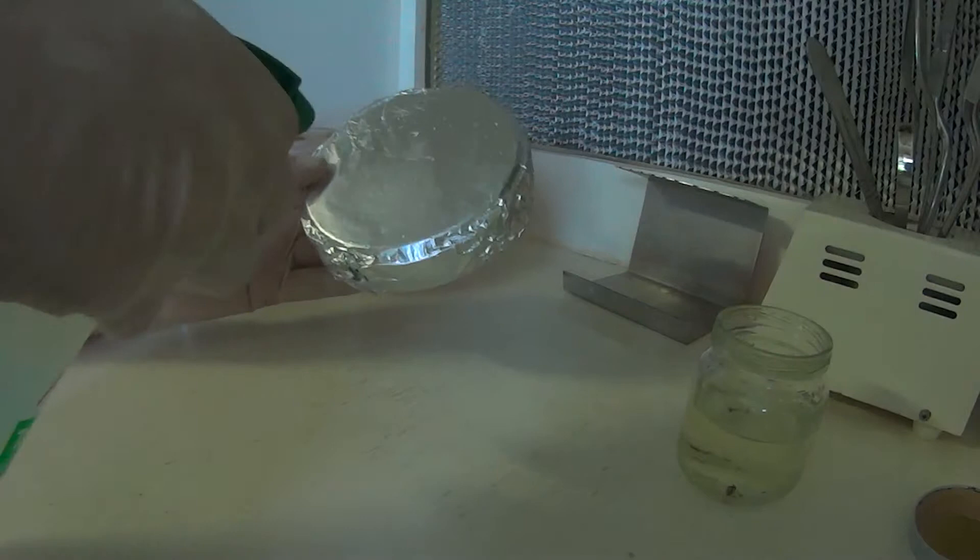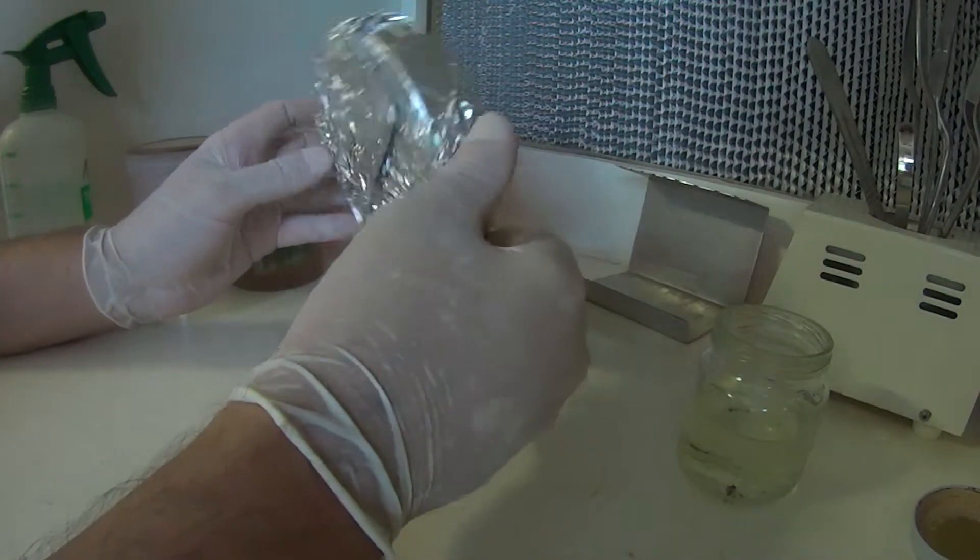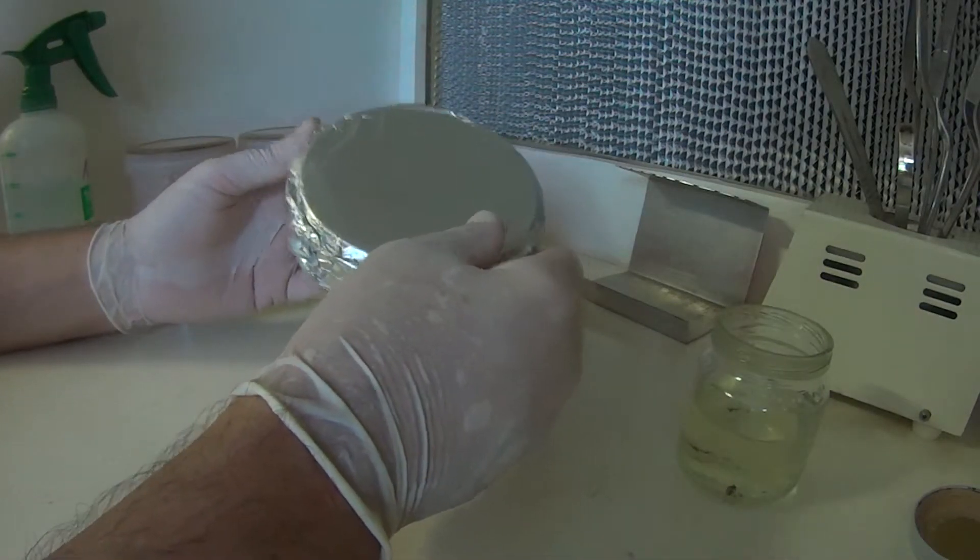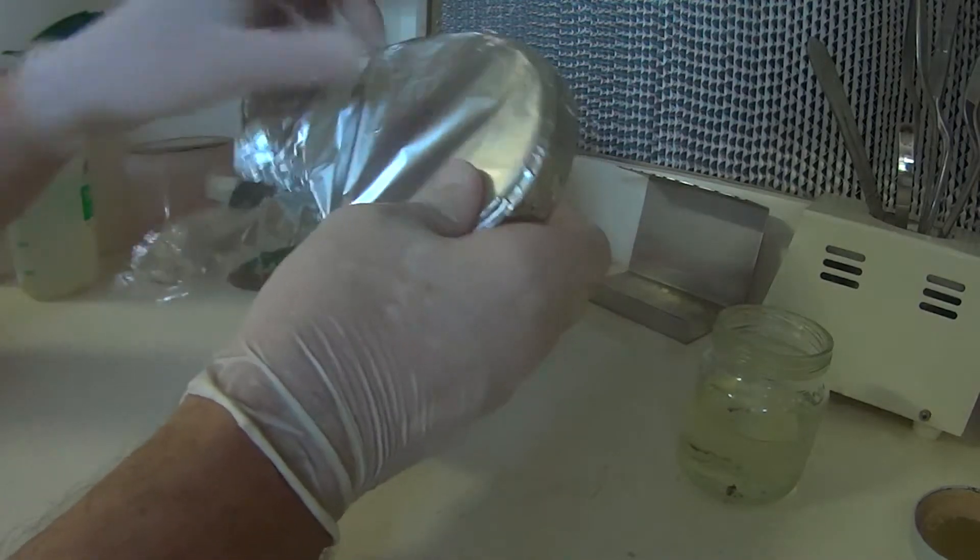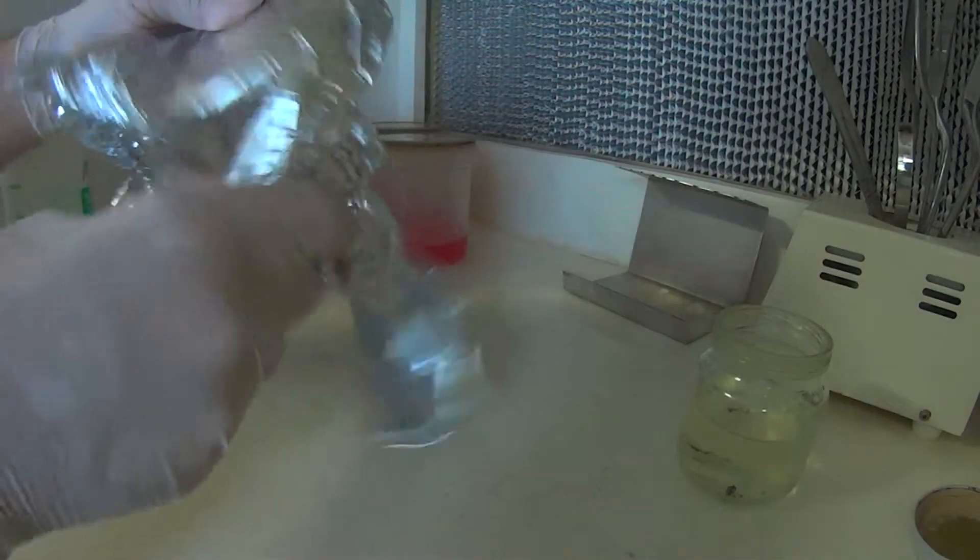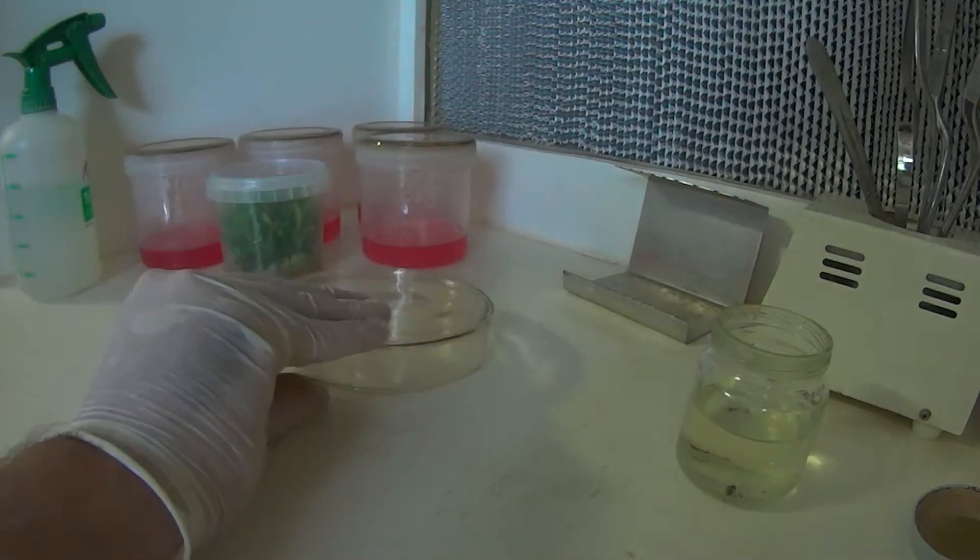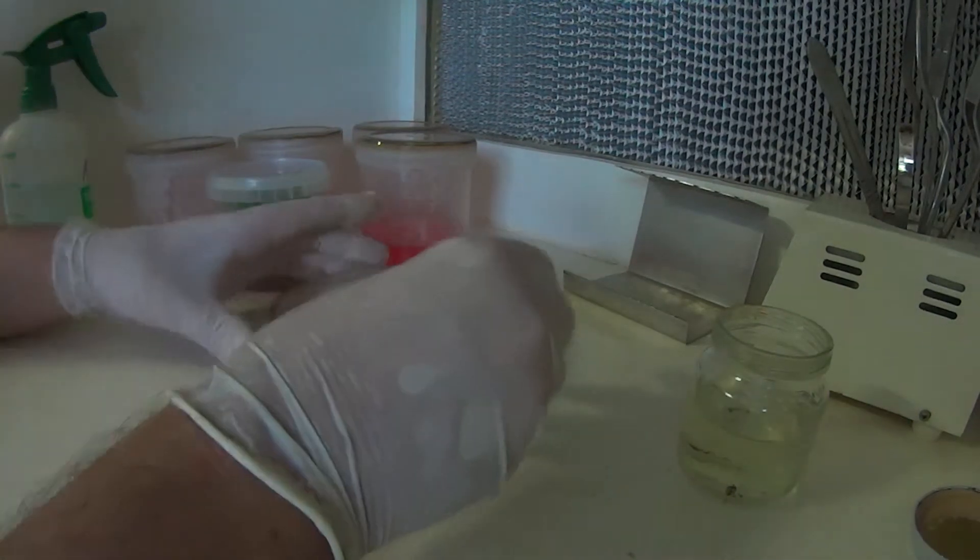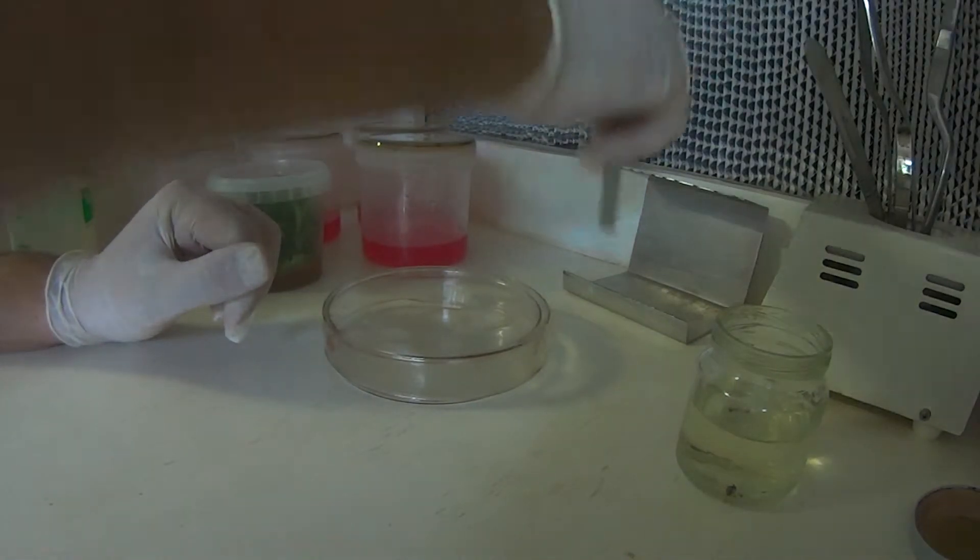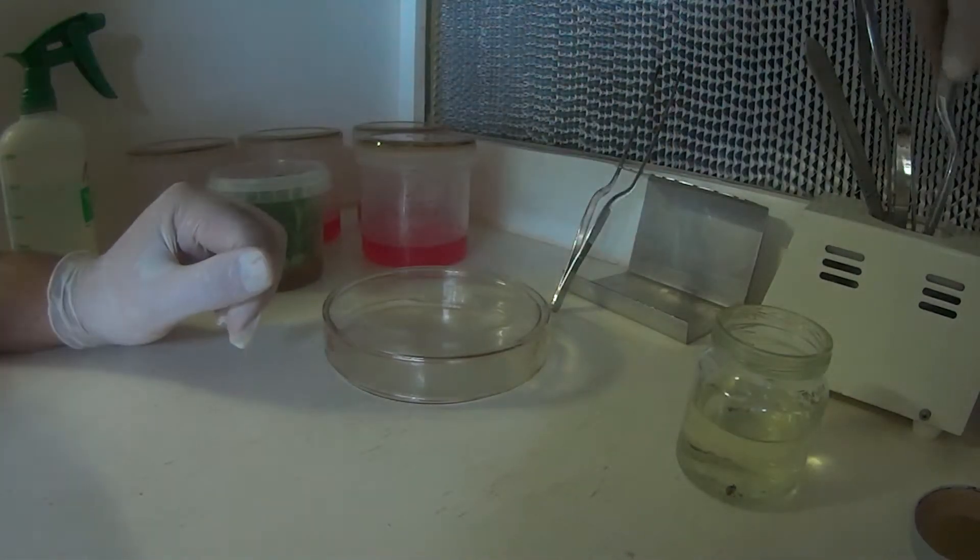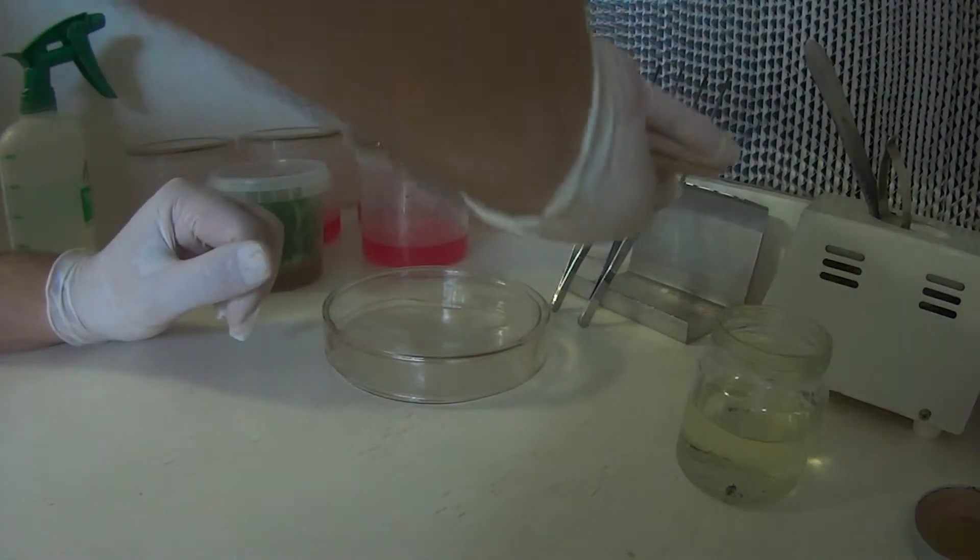Before I put it in here I'll just give it a big spray with methylated spirits again, just in case anything's settled on it. Hopefully the dish inside is sterilized, so let's open it up. These are two piece with lid, just sits over the top, so I'll get the instruments out to cool off a little bit.